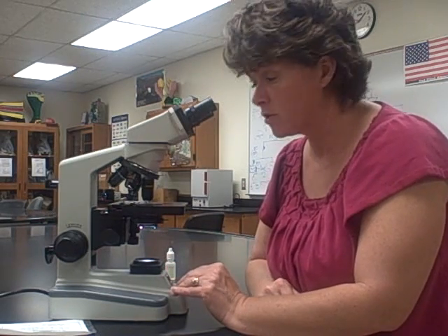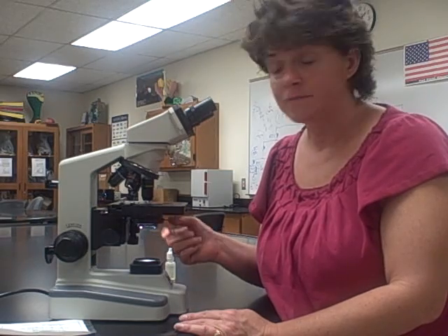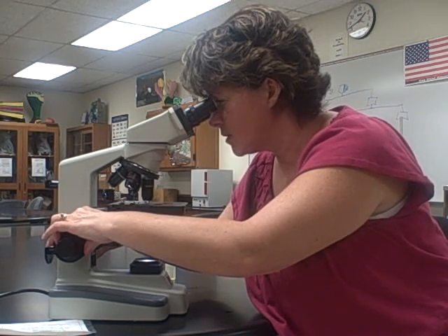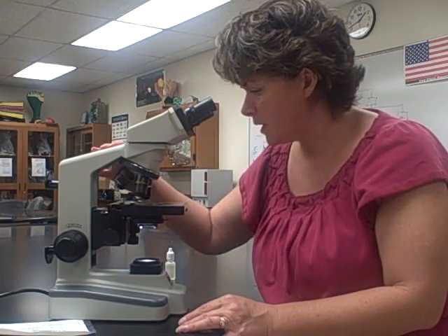Keep in mind later in the semester — if you have problems focusing on the 40x power, it may be because your condenser is too far away. Now I'm looking at my specimen under 10x power. One common mistake students make is having their light up too high, so always dim it a little when you're on 10x. I can use the coarse adjustment knob under 10x because it's not going to hit the objective. Once I find my specimen, anything that looks very large at this point is not bacteria — it's some sort of debris.